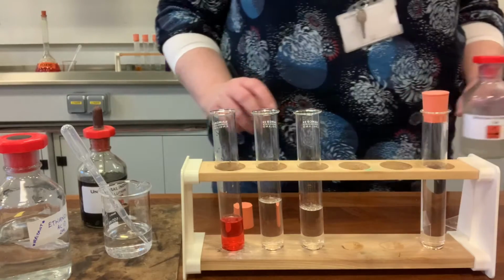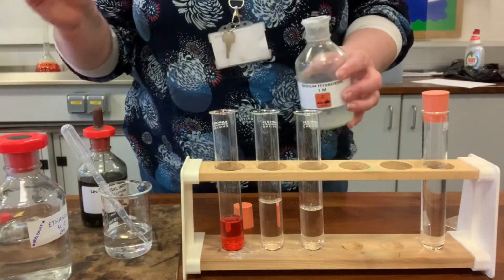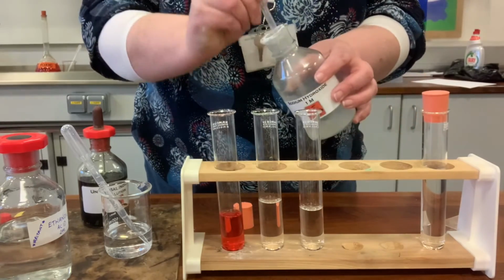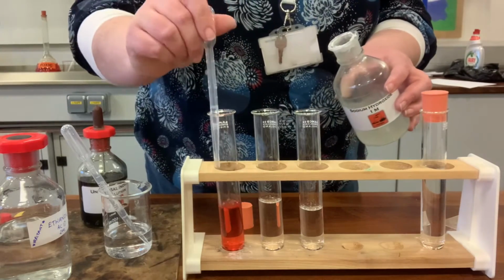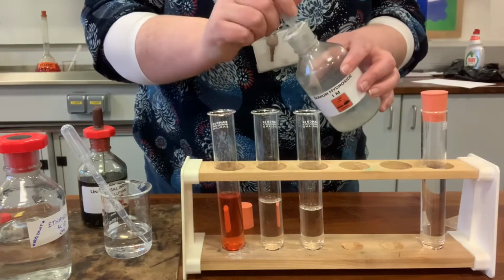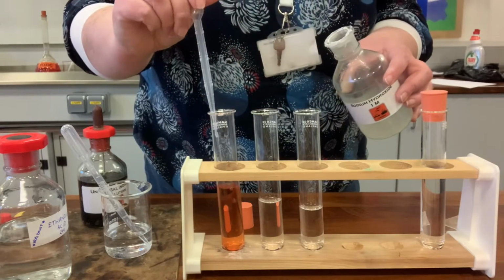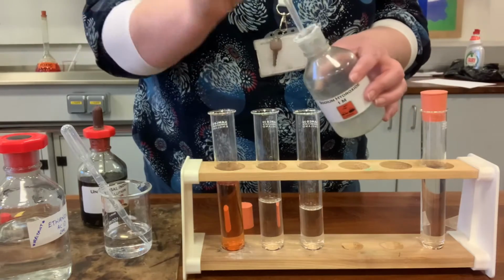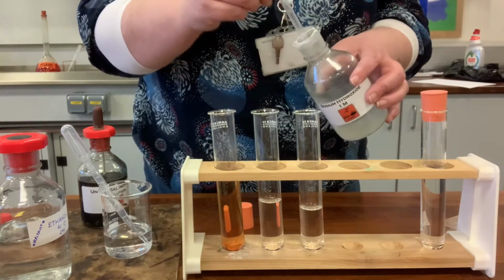So the first reaction with acids is that they will be neutralized when we add an alkali to it. So when I add sodium hydroxide to it, it might be hard just to judge this, but hopefully we'll get to see the colour change. When an acid and an alkali react together, we get a neutral solution. We get salt plus water, if you remember back from your acid and base topic last year. So I just add this in, see if I can get it to go green. It may not get exactly green. It's starting to change a wee bit.